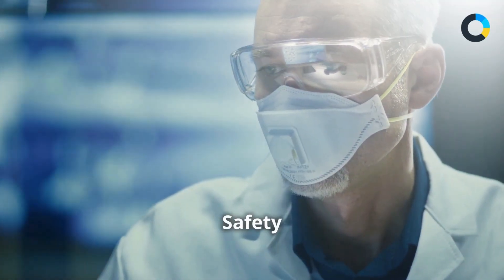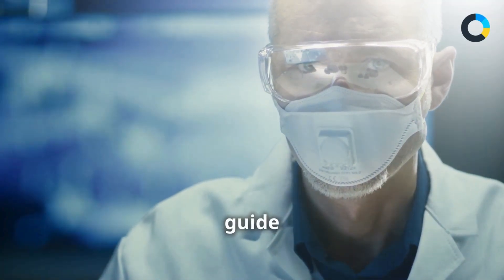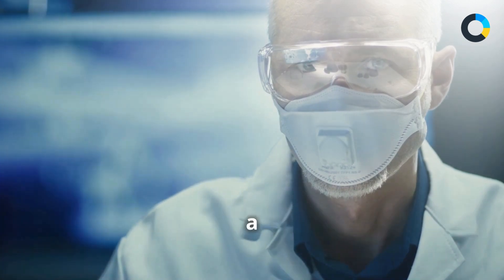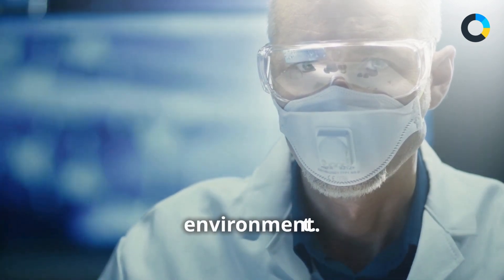Welcome to the lab safety training course, your essential guide to maintaining a safe and compliant laboratory environment.